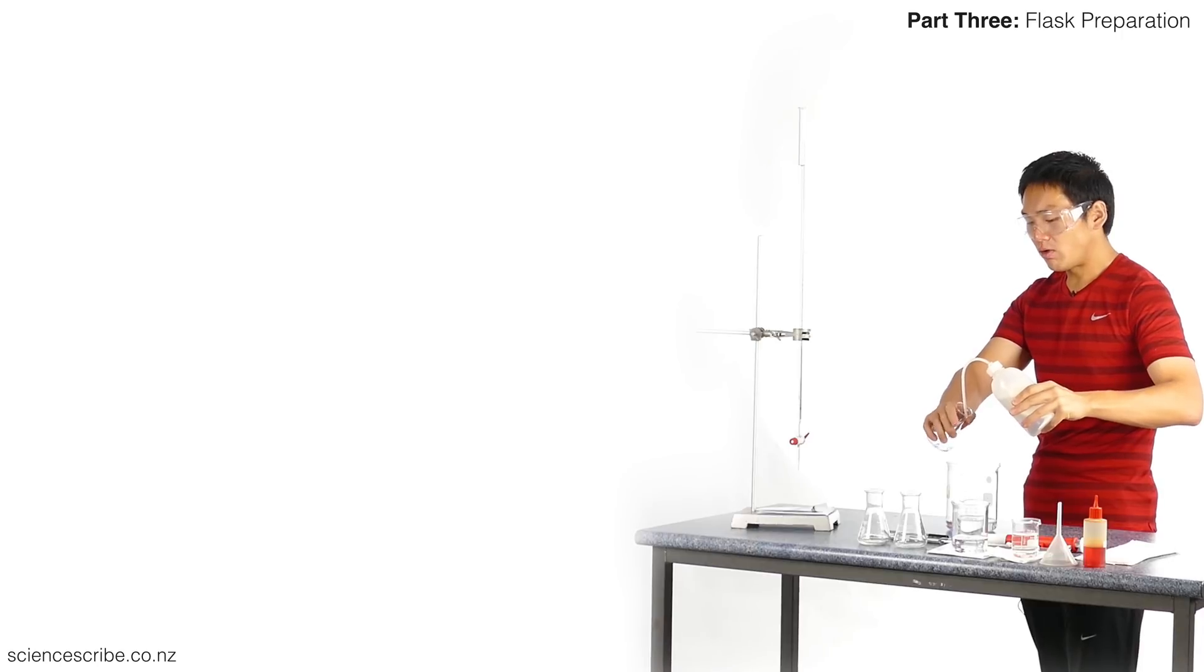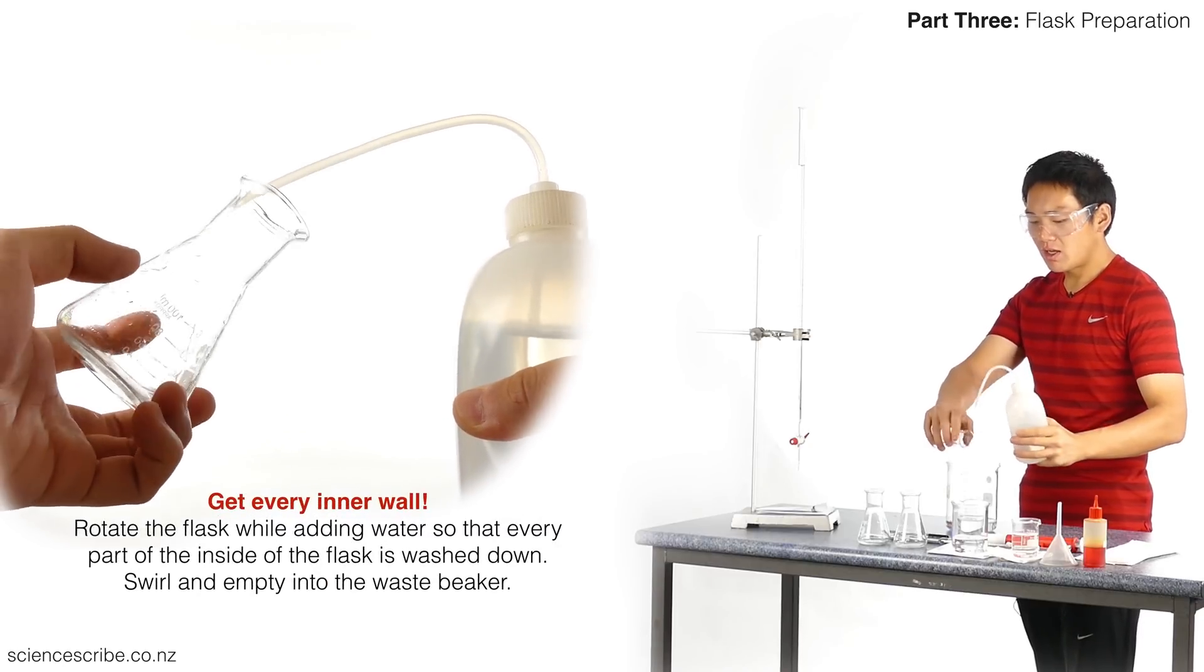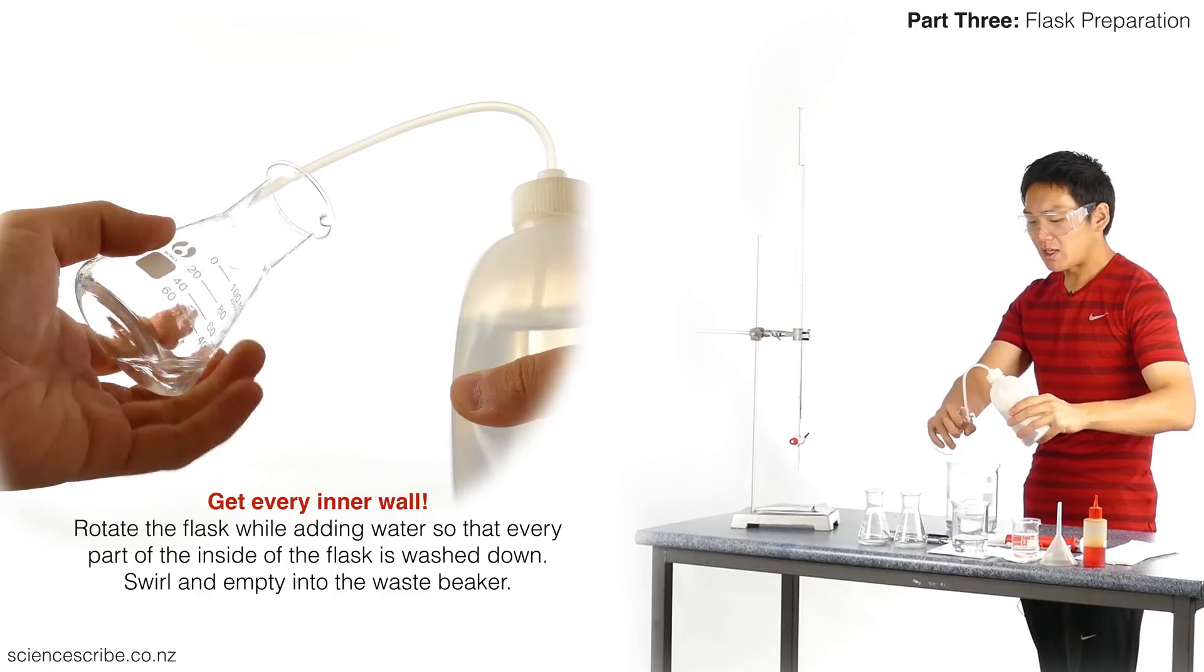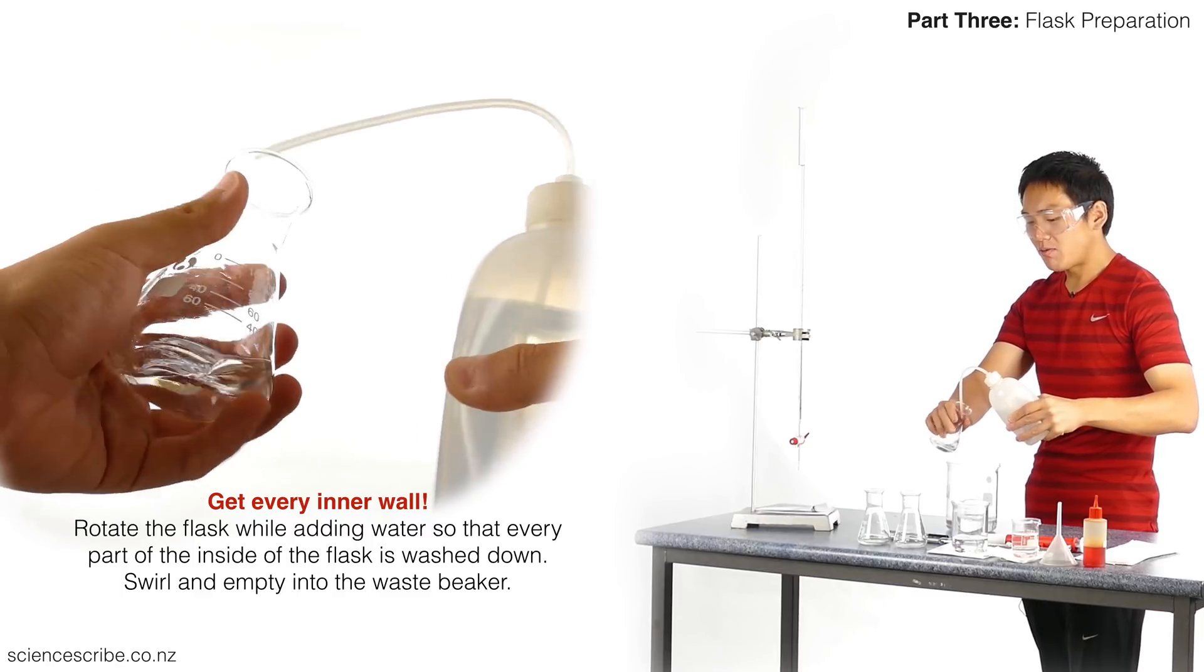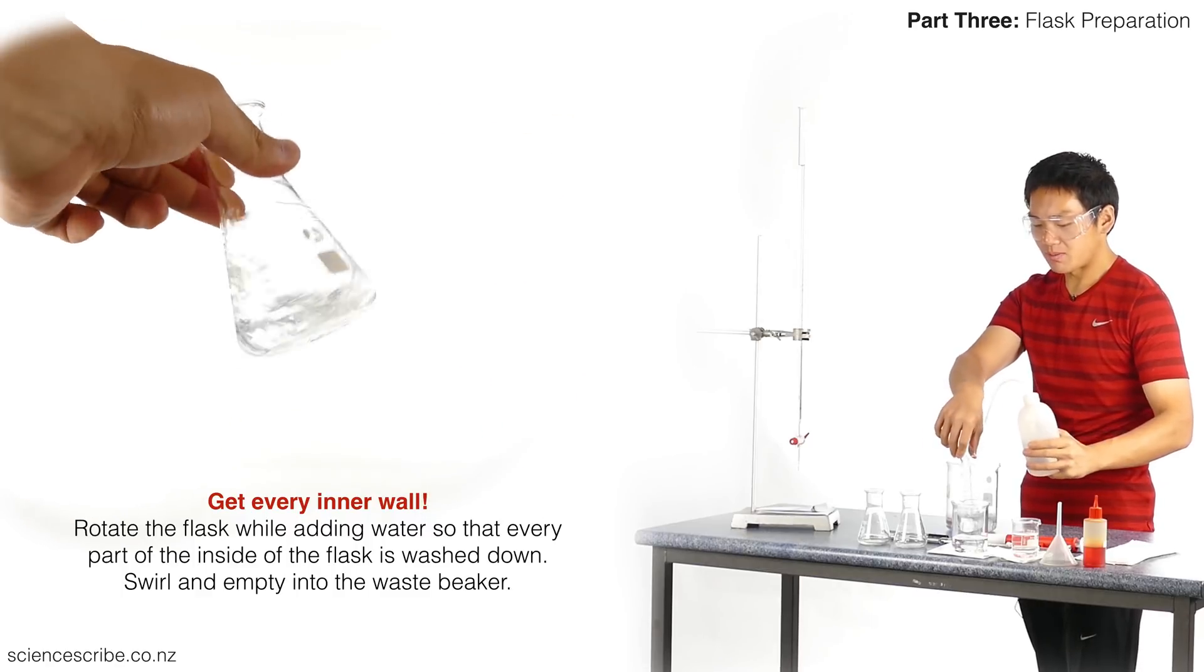I don't know who else has been using my flasks or where they've been, so I'm going to give them a wash. Just like my other pieces of equipment, the magic number is three. We're going to wash stuff out three times. We're going to do that with all of our flasks.